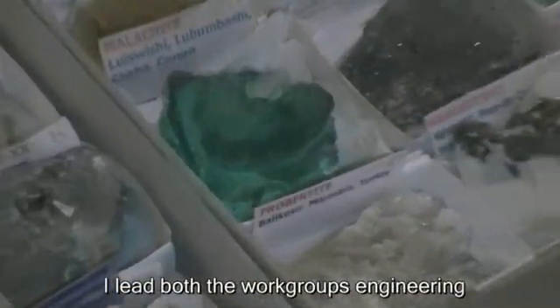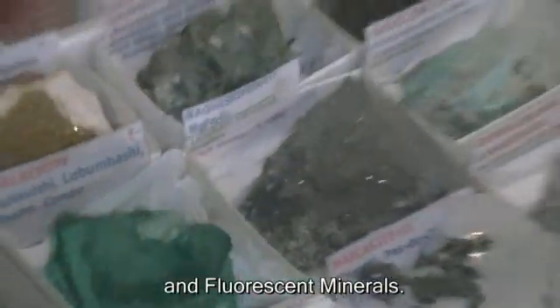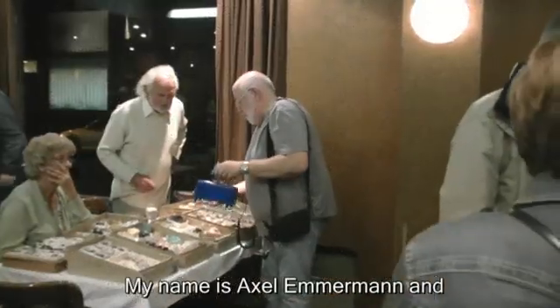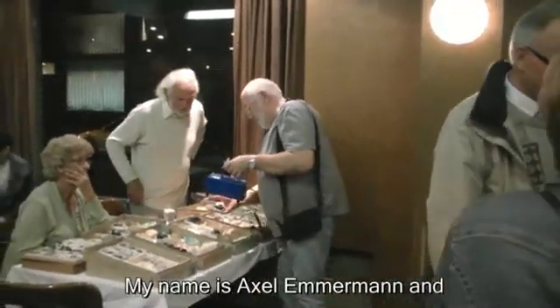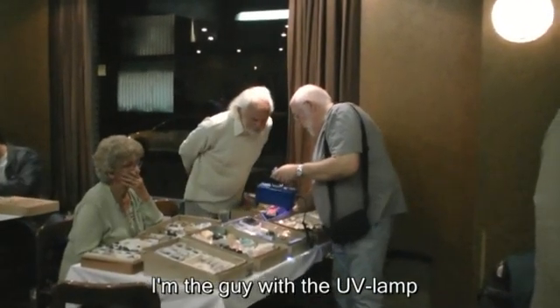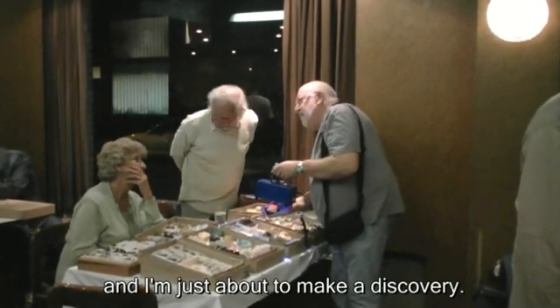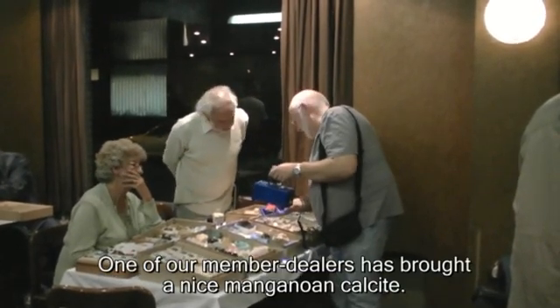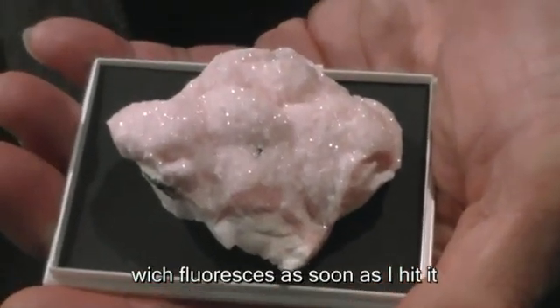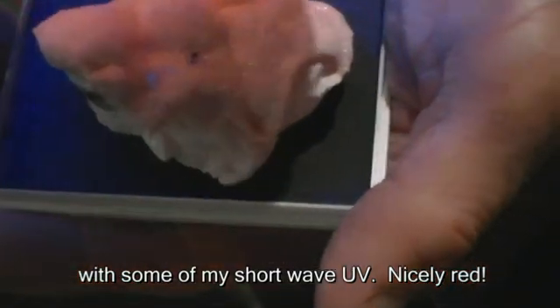I lead both the workgroups engineering and fluorescent minerals. My name is Axel Emmerman, and I am the guy with the UV lamp. I am about to make a discovery. One of our member dealers has a nice manganoan calcite with him, which fluoresces as soon as I hit it with some of my shortwave UV. Nicely red.